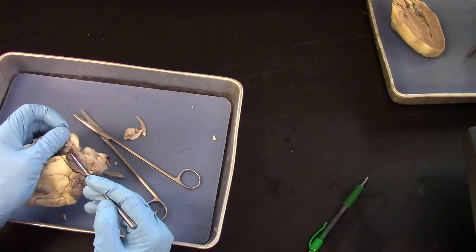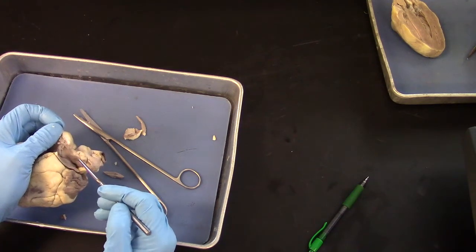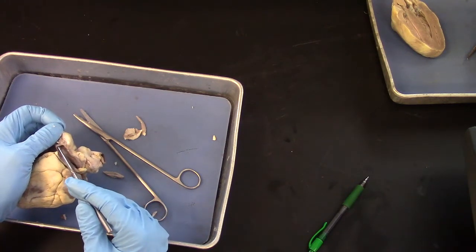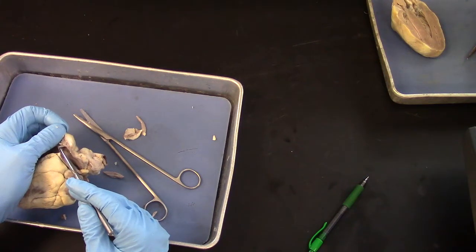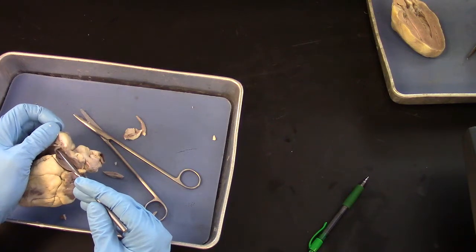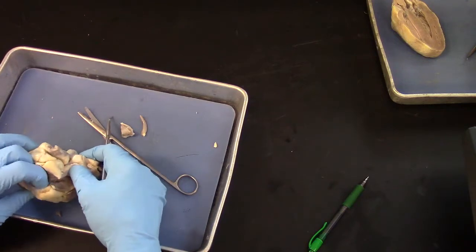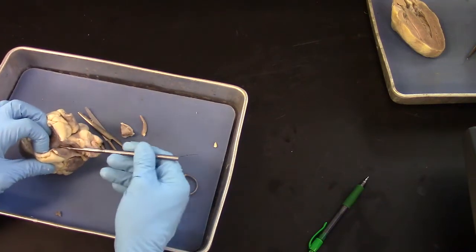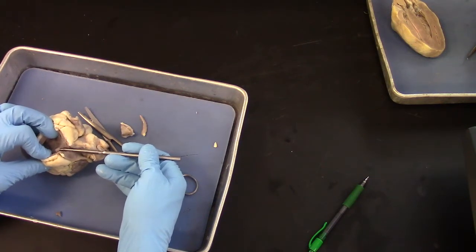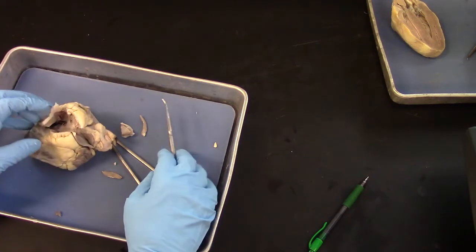So here's one of them. And the blood that's in the pulmonary trunk, when the heart relaxes, the blood wants to flow backwards, hits the pulmonary valve, and is trapped from going back into the right ventricle. So there's one flap on that area. There's another one on the other side. They form a ring going around the entrance to the pulmonary trunk. So those are the pulmonic valves, and that's basically the right side of the heart.